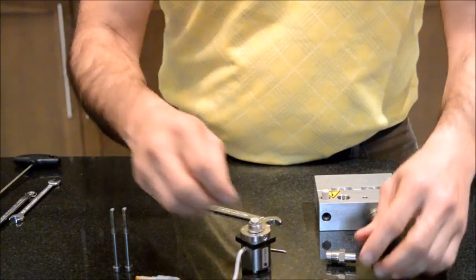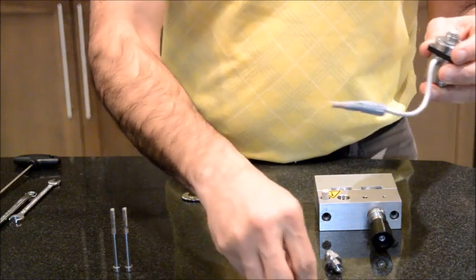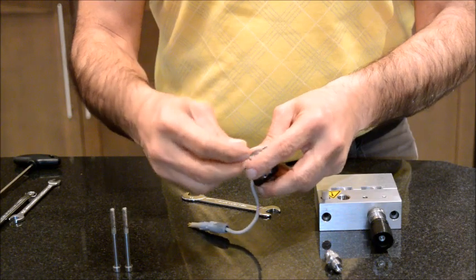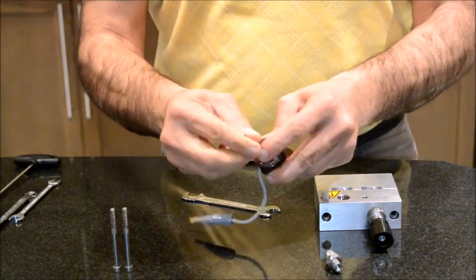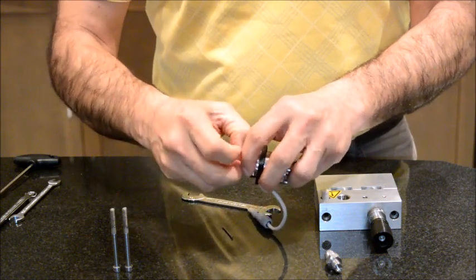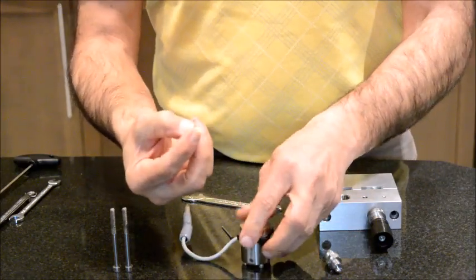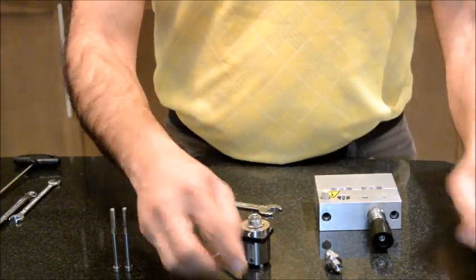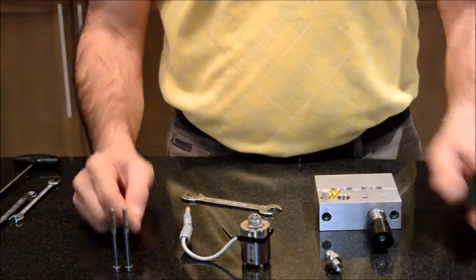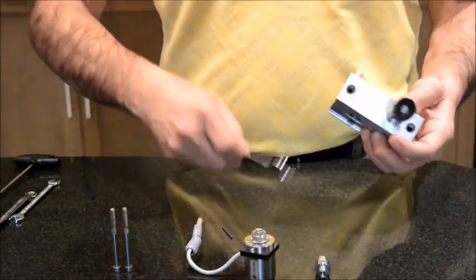For the inlet valve, it's similar. I'm going to put this away. For the inlet valve, similarly, there is a piece here, you remove it. You replace this part. So by replacing these two parts for your inlet and outlet, you're going to have your problem resolved. Now next, I'm going to talk about the purge valve. I'm going to open the purge valve up.